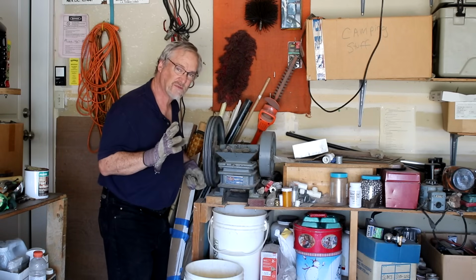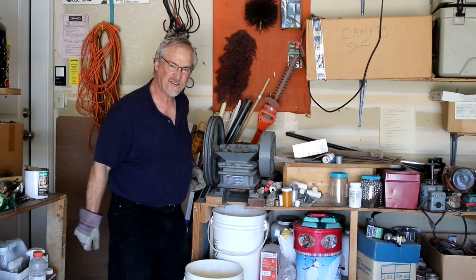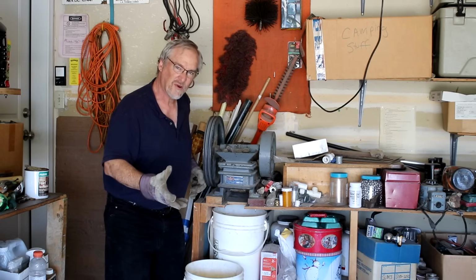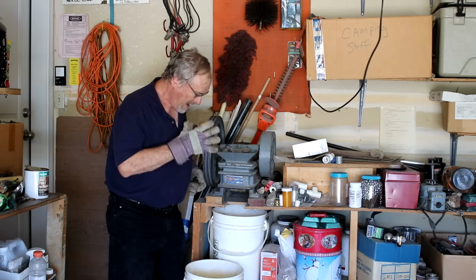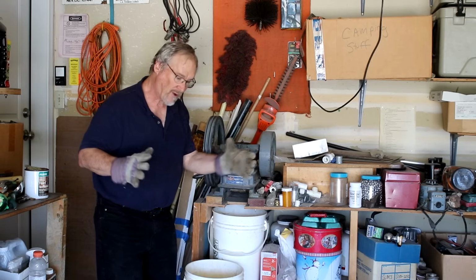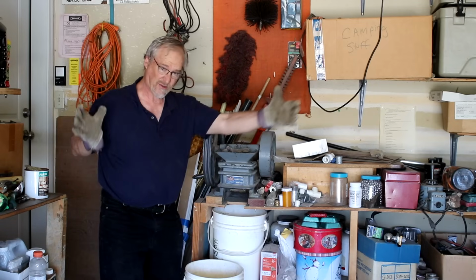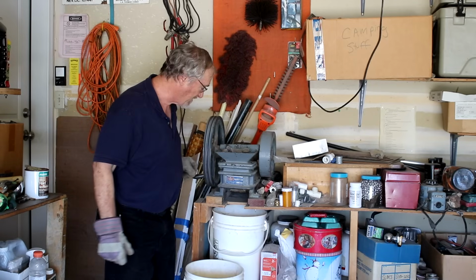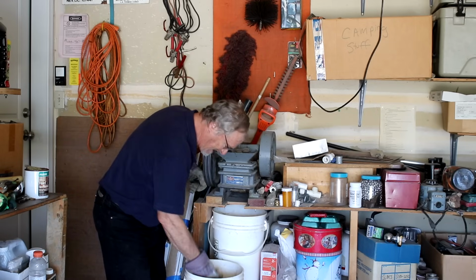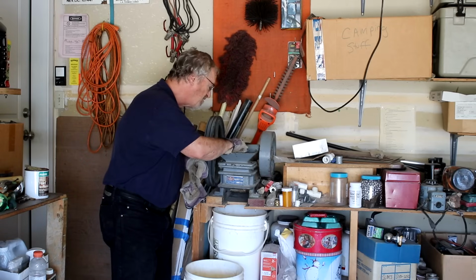The jaw crusher works pretty good. These jaw crushers of this type have been around since the 1800s. They used to use them in front of the stamp mills. So the rock came in, went through a jaw crusher, and then into the stamp. And of course, this is a tiny, tiny jaw crusher. They make ones where the opening is a couple feet across, or even bigger, 3 feet. I've seen ones as big as 3 feet across, and they make them even larger. But this is a little tiny guy, and I'll be using it to break my rock down to usable size.